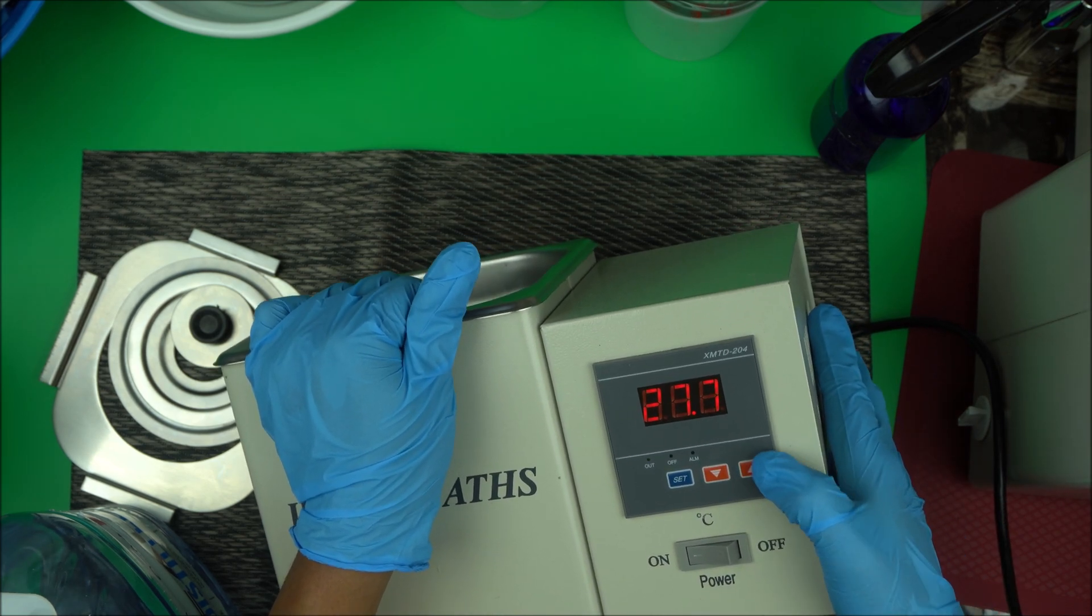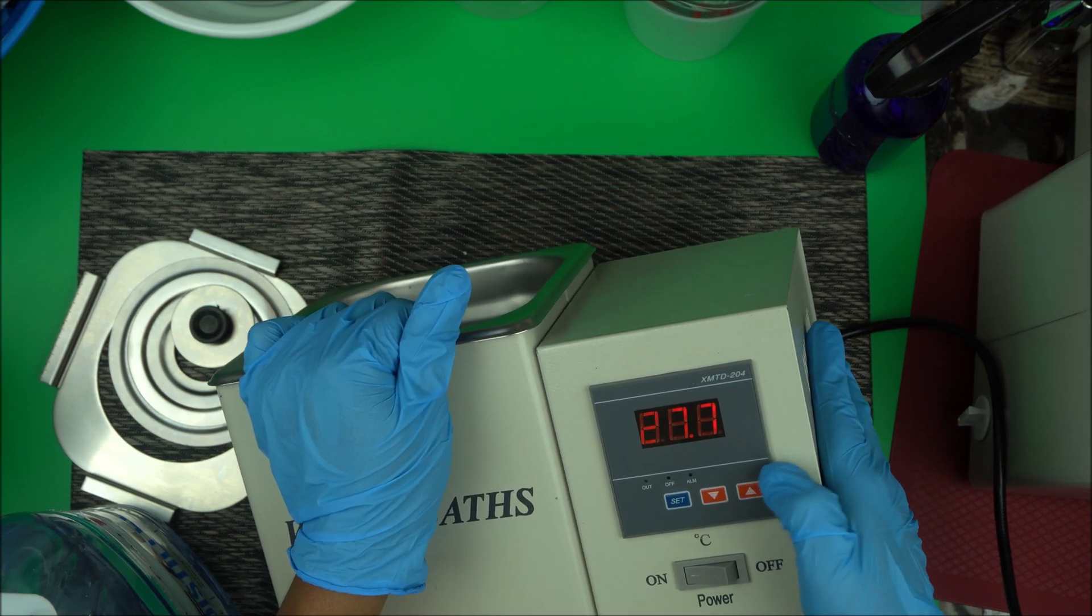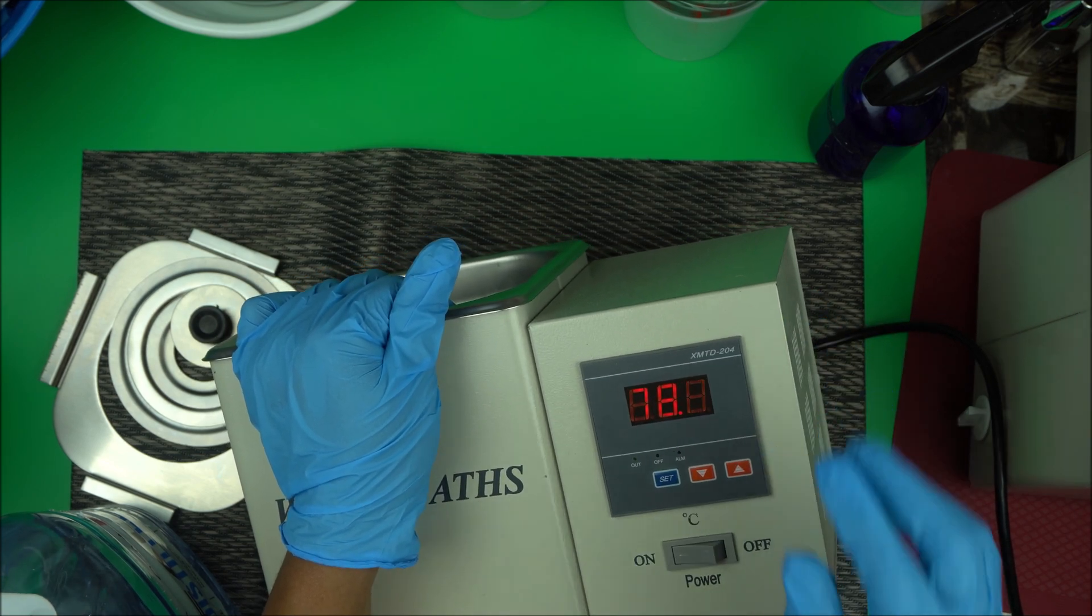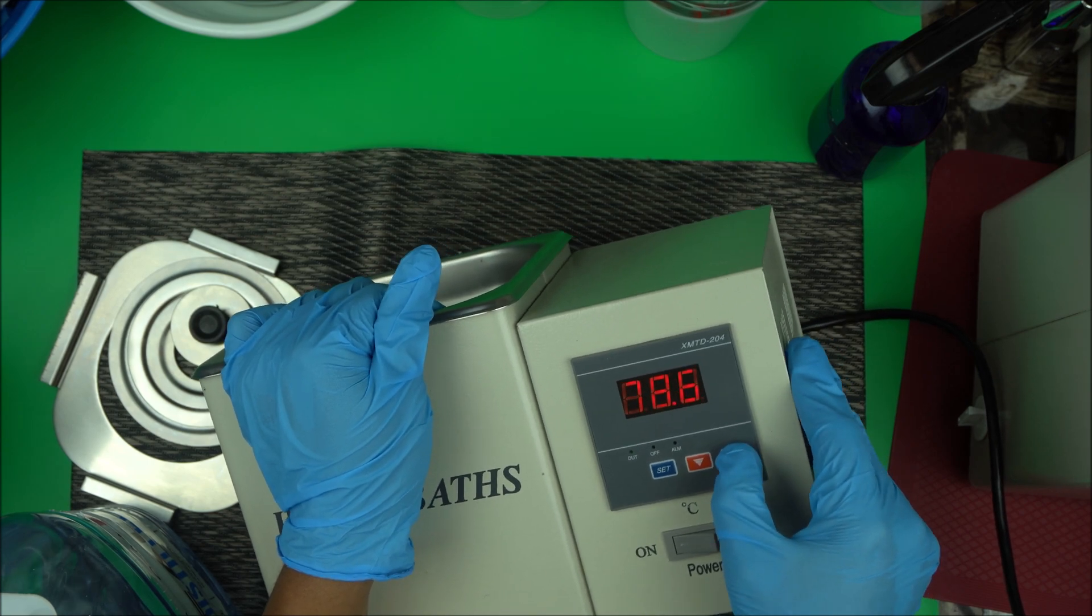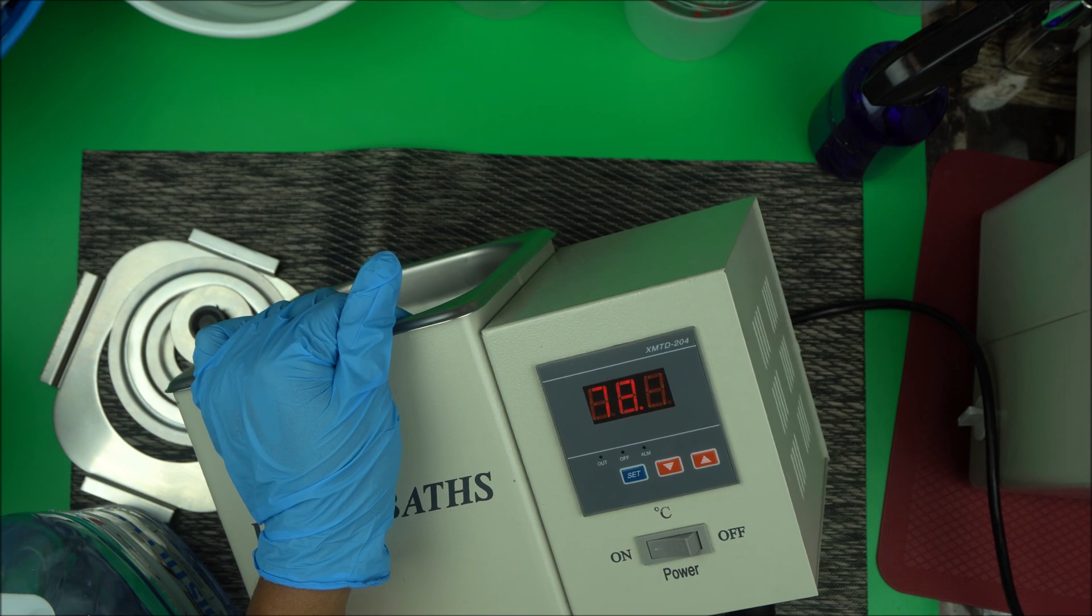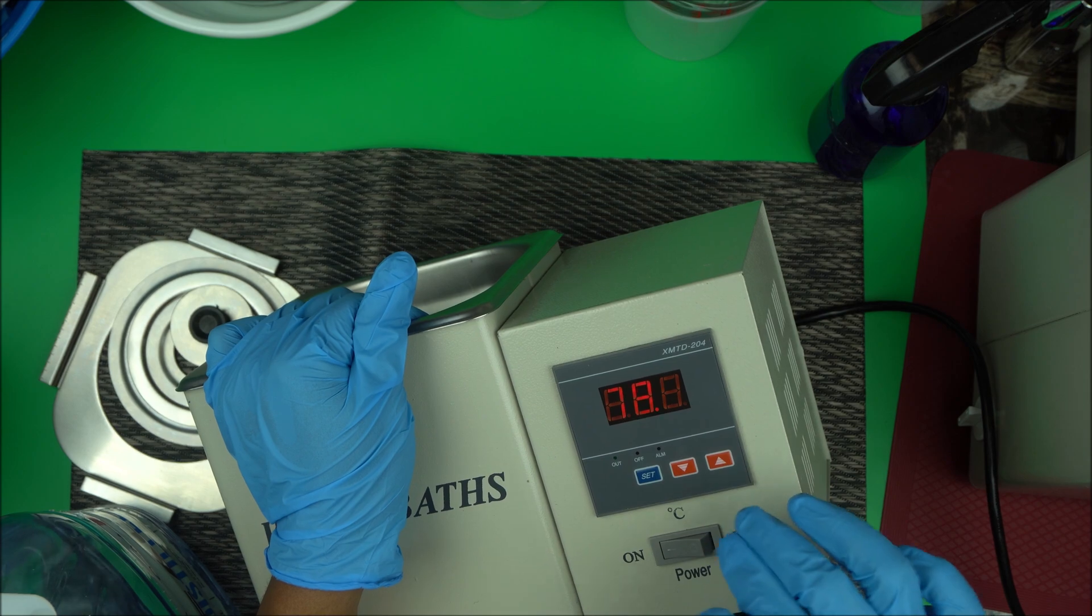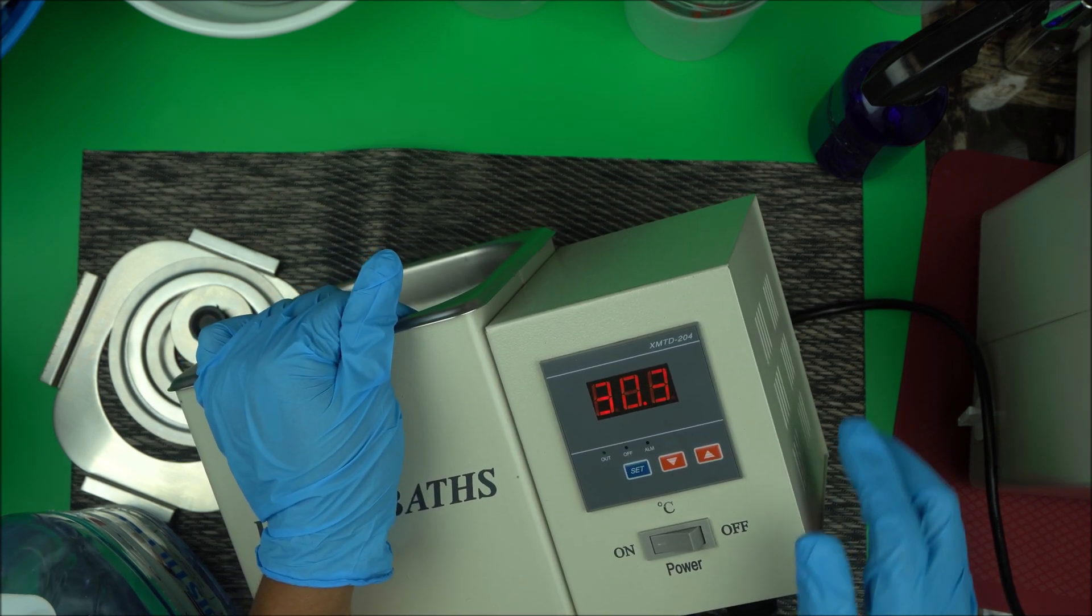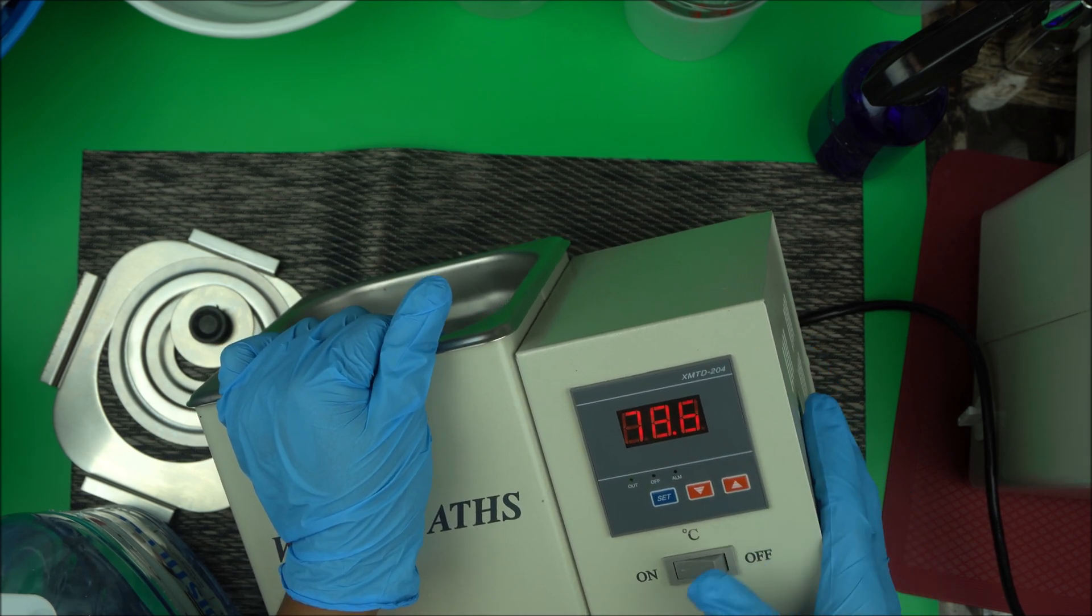You can control the temperature from here. You press set, and right now it's at 78 degrees Celsius. You can increase it up using this or bring it down using this. Once you get the temperature right, you press set and it stops right there.